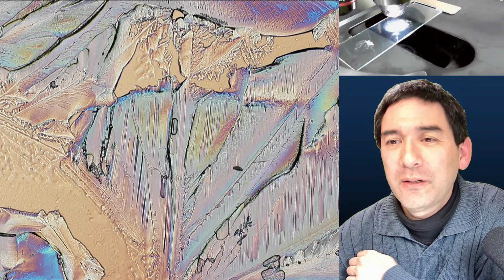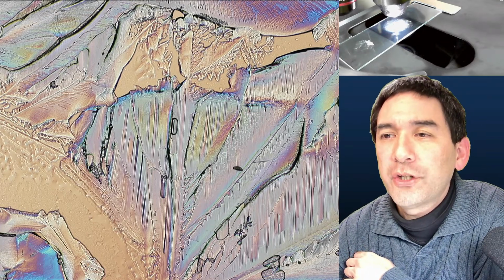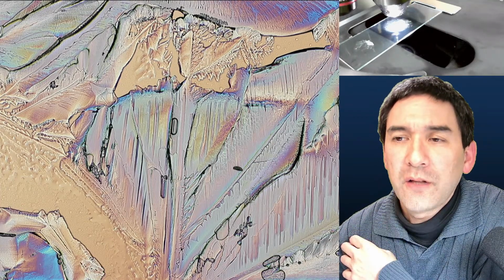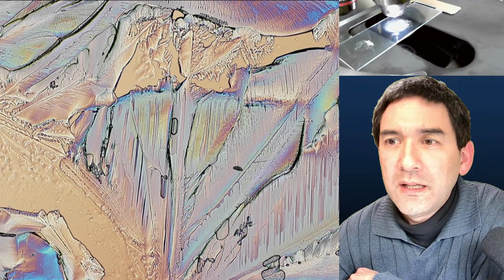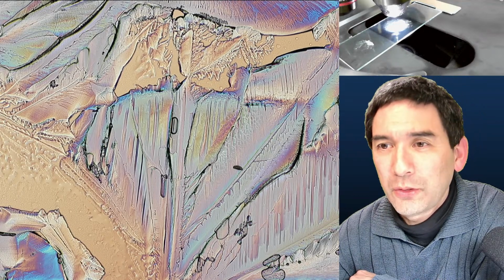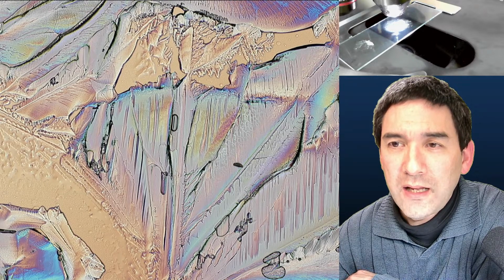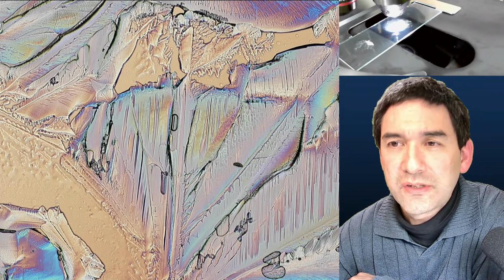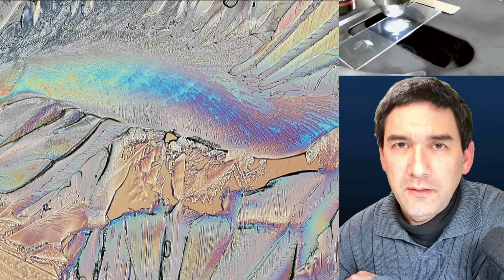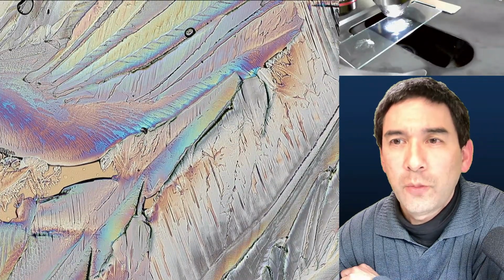So yeah, I'm quickly checking here. Could you explain how retardation plates work? Is it possible to make it a do-it-yourself project? Retardation plates are, I think, the so-called lambda fourth plates. And what they do is they convert linear polarized light into circular polarized light. Yes, it is possible to do this as a do-it-yourself project. However, I had some problems getting those lambda fourth plates. You have to simply order them. They are available. I know that many physics labs and schools use those. But these are not quite as commonly available.